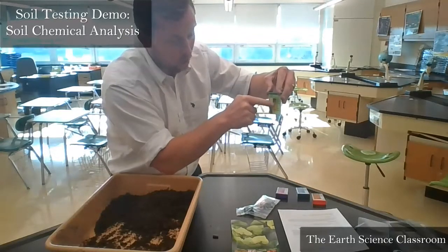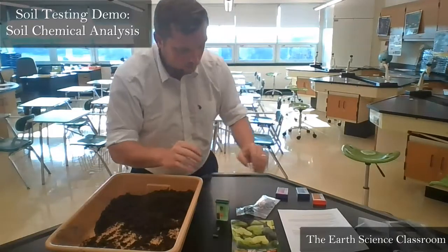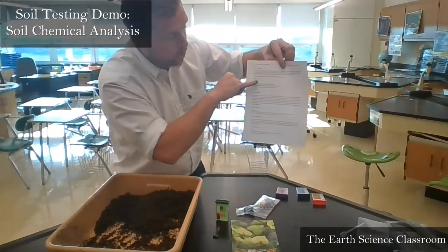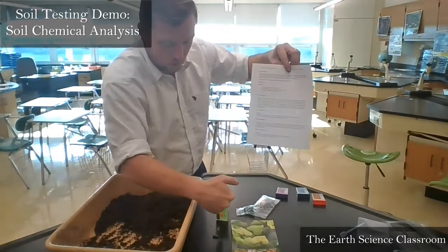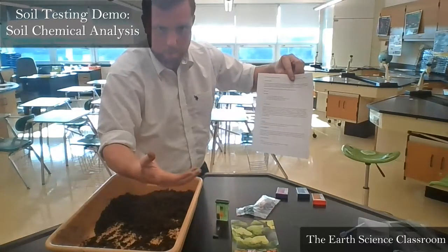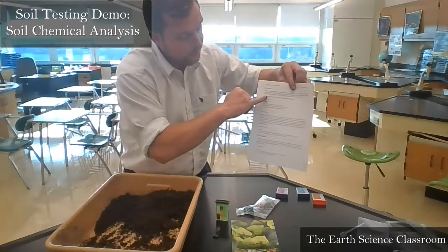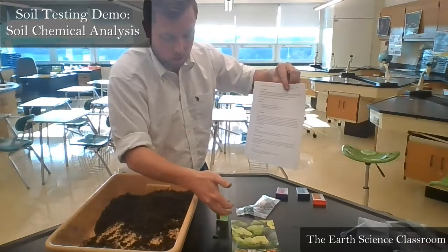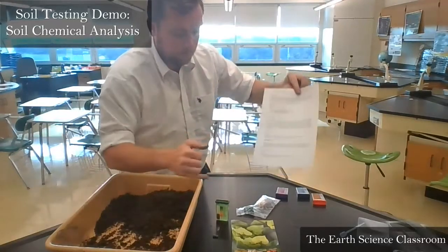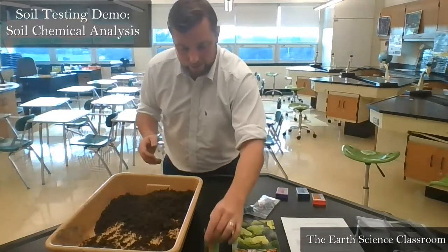water with the color of the scale, and then you write down, so leave it nice and there. You have your lab, and then you write down the pH number, 6.5, 5.5, 5, whatever the color of the water is, you match with the scale, and you put the number right there. So let's say our soil is pH 5.5. Put that down, and you're done. That's our pH test. We leave that there.